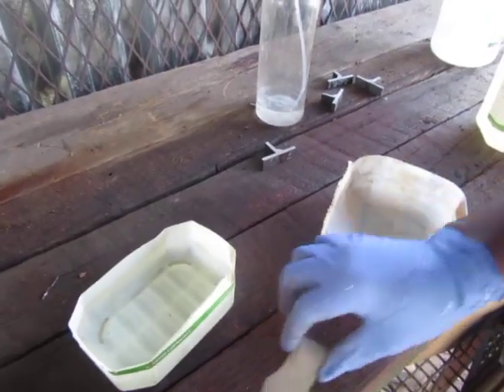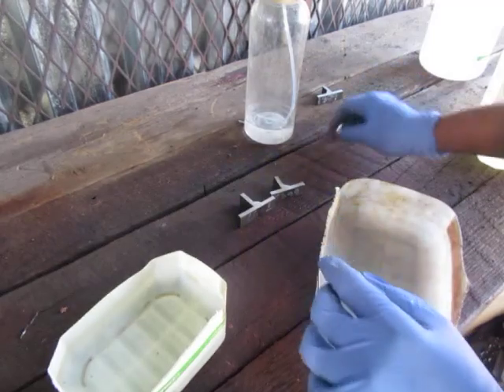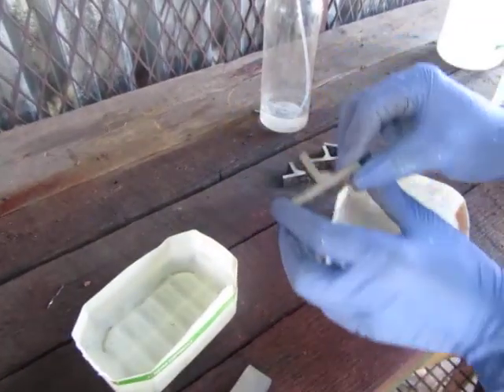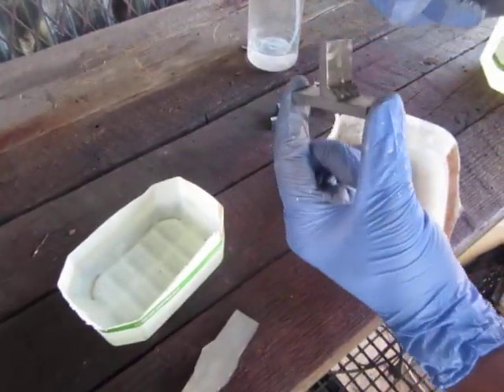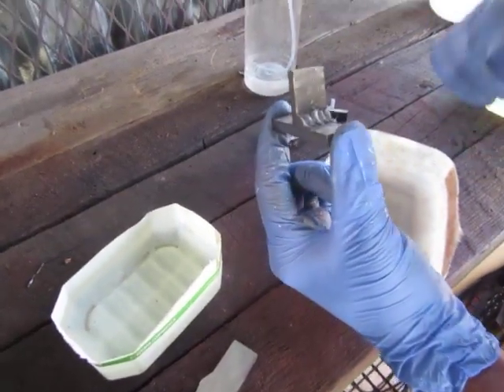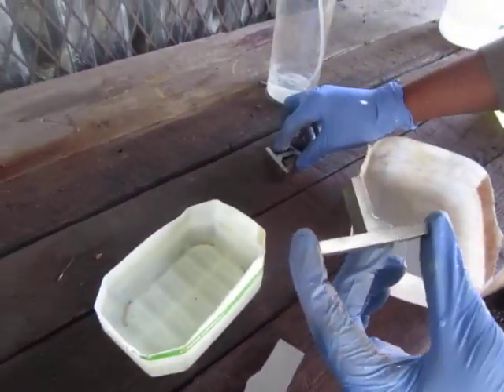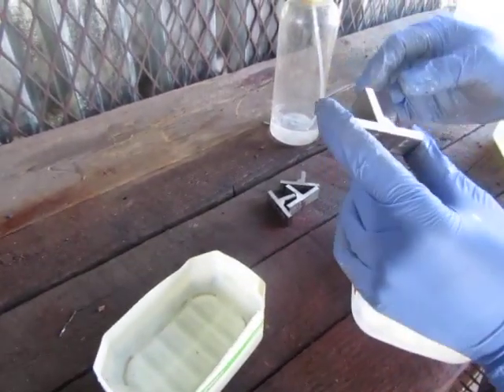These here are macros, as well as this one — this is also a macro. But the difference between this macro and these macros is that this one is a fillet weld. Okay, that's a fillet weld. These are fillet welds.